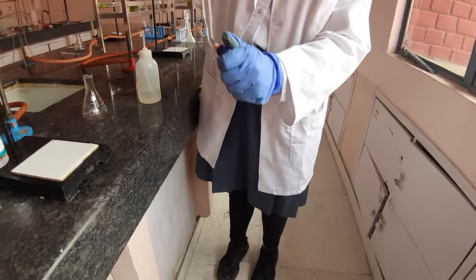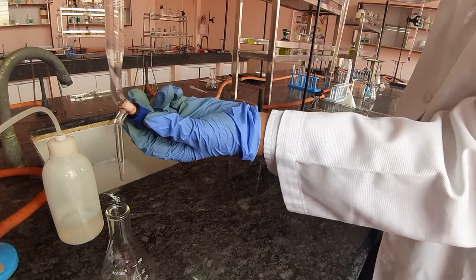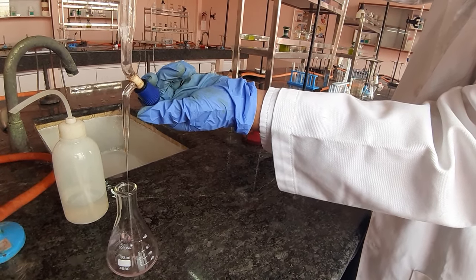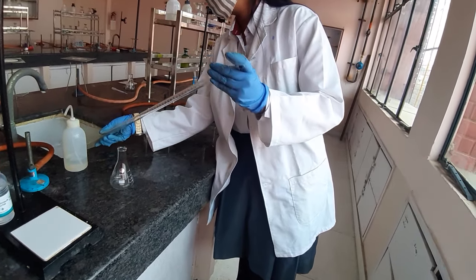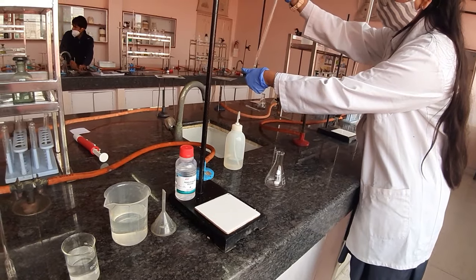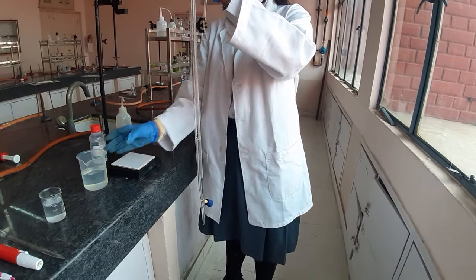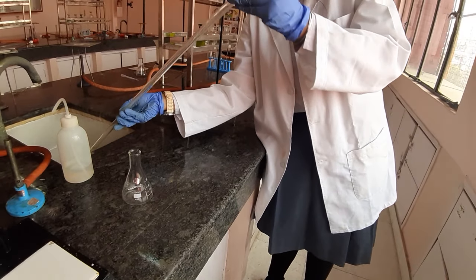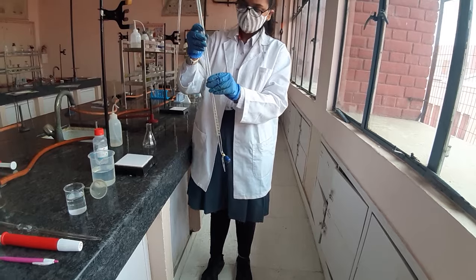Please put the knob on so that we can see exactly what happens when you put the knob off. You can put it into the conical flask. This is the knob which helps you to monitor the amount of base that you will be adding into the conical flask. Wash it with the water and then discard it into the sink. Once the burette is washed, you need to add the base — NaOH — into it for rinsing. She will roll and discard it into the sink so that the burette gets rinsed with NaOH. Some amount should also be passed through the nozzle so that the nozzle is also cleaned with NaOH.